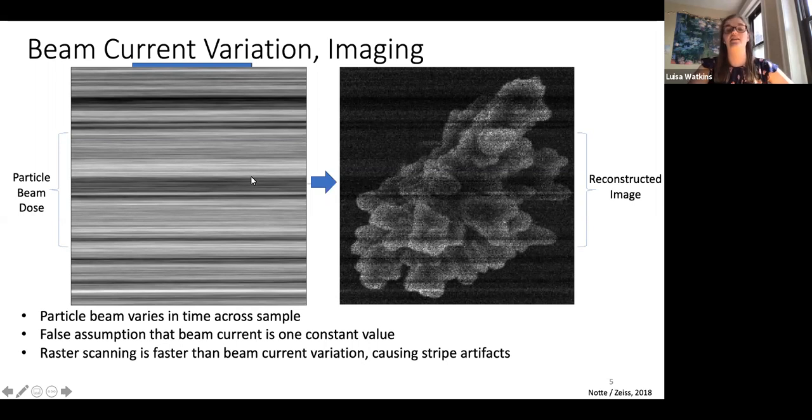These stripe artifacts come from the fact that the raster scanning is faster than the beam current variation. In an image like this, you may think, well, the sample looks like it should just be this portion, and these stripes make it harder to see the image, but I can still kind of see what it should look like. But the major issue is if the sample we're trying to look at actually has stripes in it. If there are striped artifacts, it's hard to tell whether these stripes are from the beam current varying or are actually in the sample, and that can be a big question and be really tough to figure out what the sample looks like.